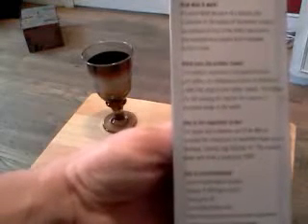The higher the TDS reading, the higher the amount of dissolved solids in the water. Why is this important? The tester will empower you to be able to evaluate the cleanliness of whatever water you're drinking — bottled, tap, filtered, etc.